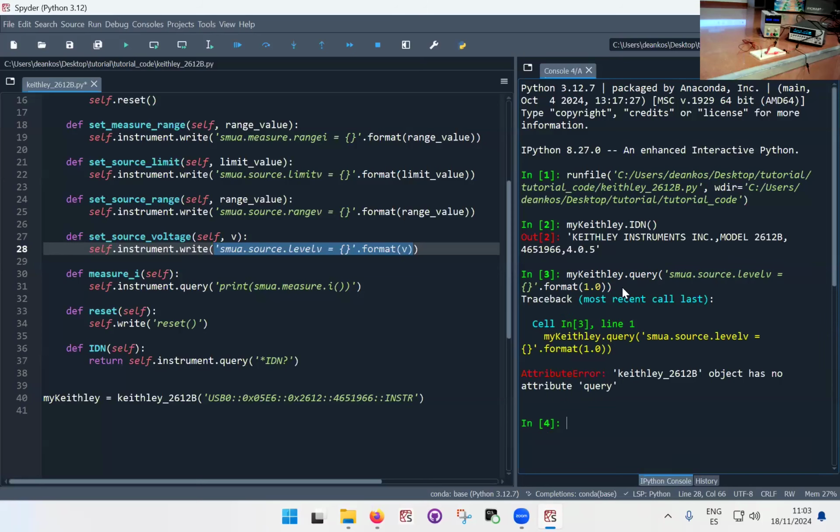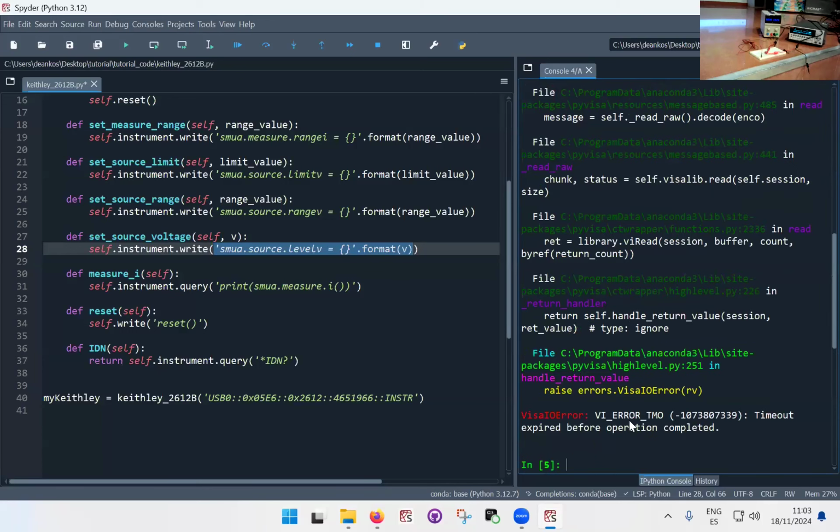Oh, sorry. Yeah, because my Keithley, that's the instrument, but inside the class, I have the instrument object, which is what is supposed to be the querying. Okay, so I just skipped that. So you see now here it's set to 1 volt. But you see it's giving me a timeout error. No panic, it's a timeout error. I asked something from the instrument, it didn't reply, and at some point it times out. It just means that Python is not going to, by default, make me wait forever for something to come back if nothing is coming back. It was supposed to come back ages ago in computer time.